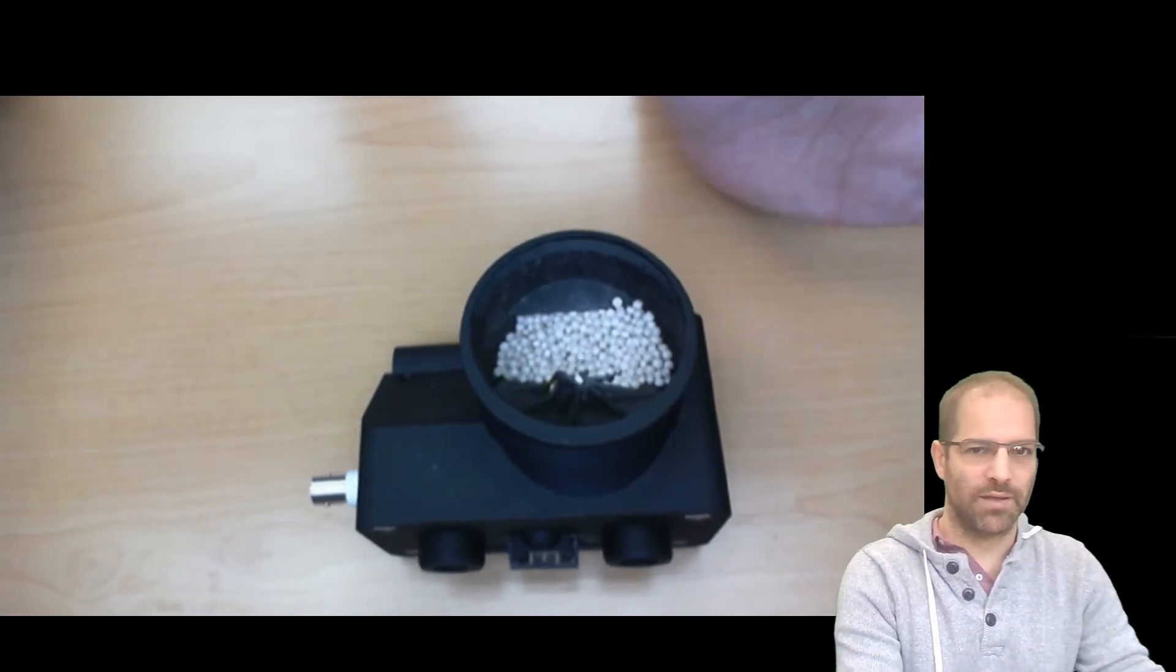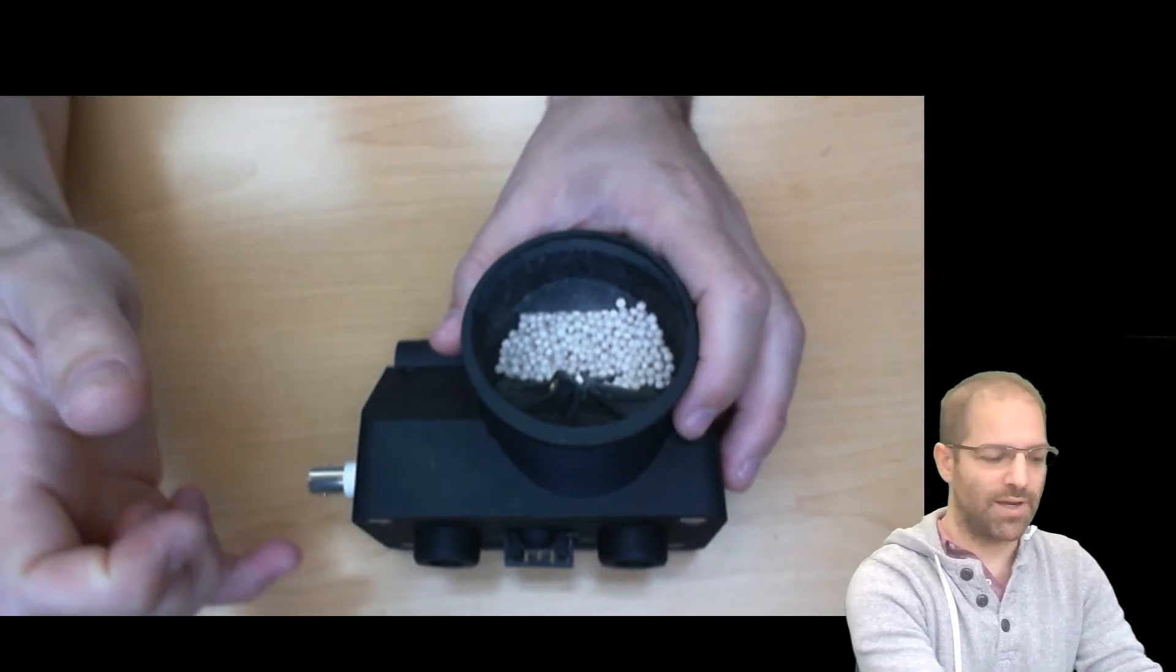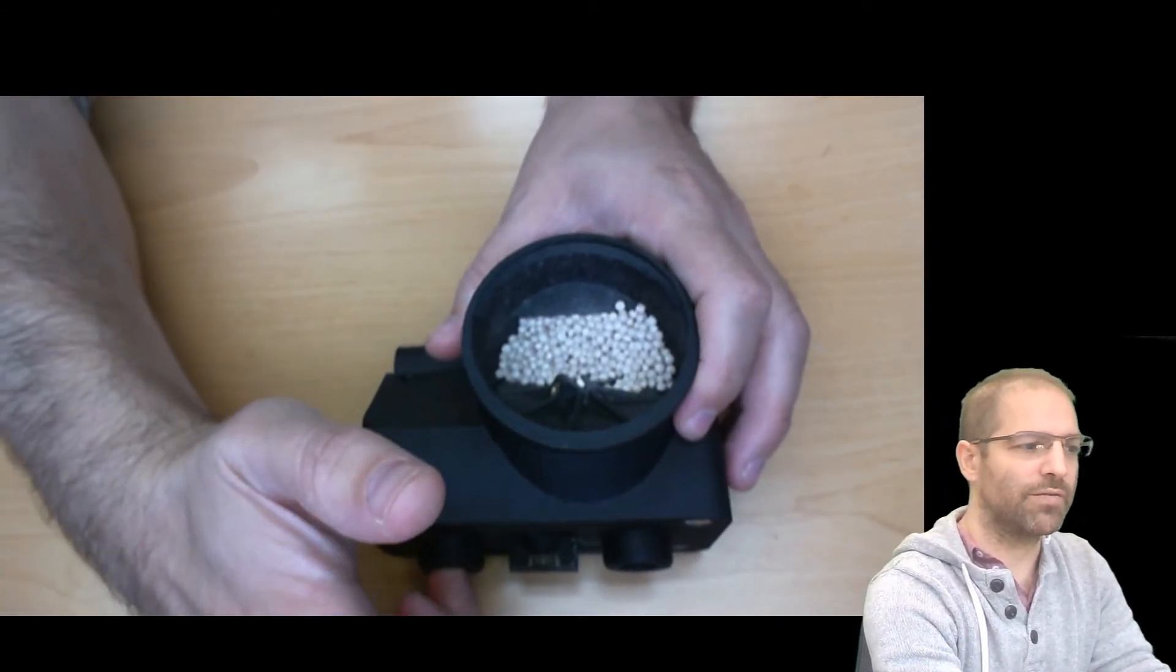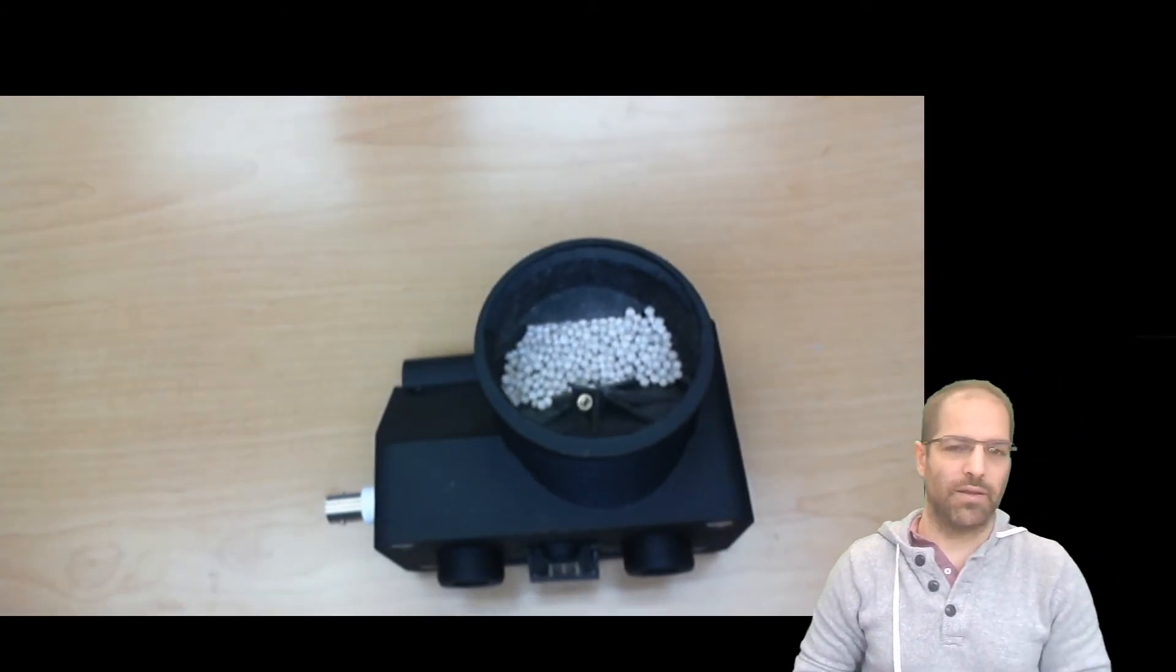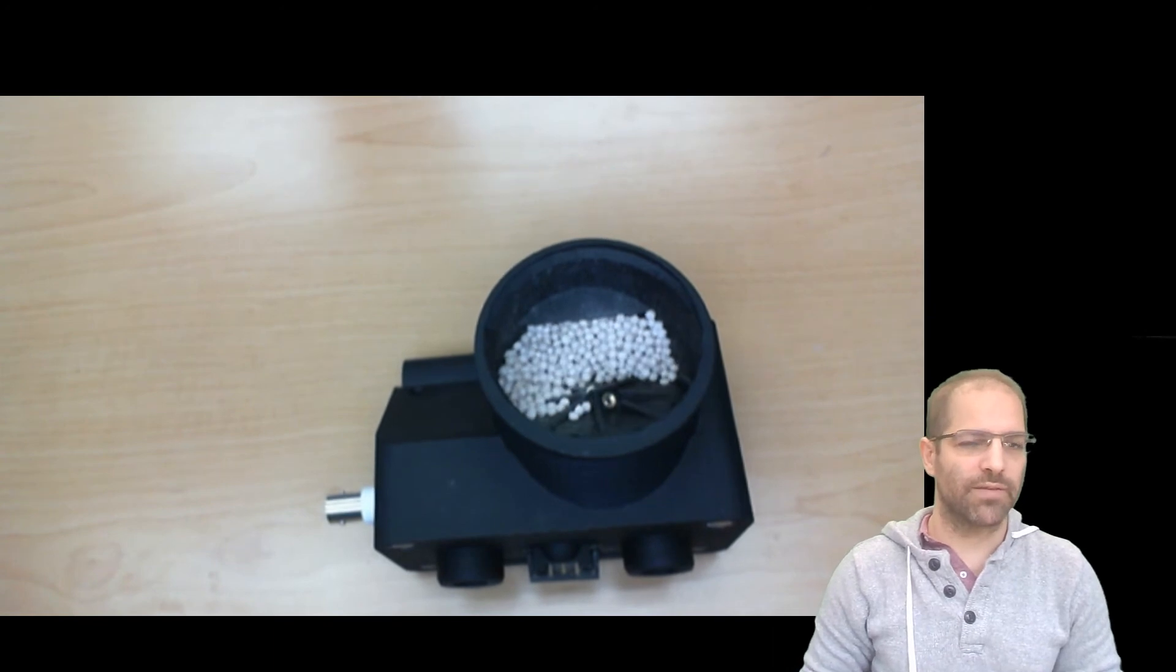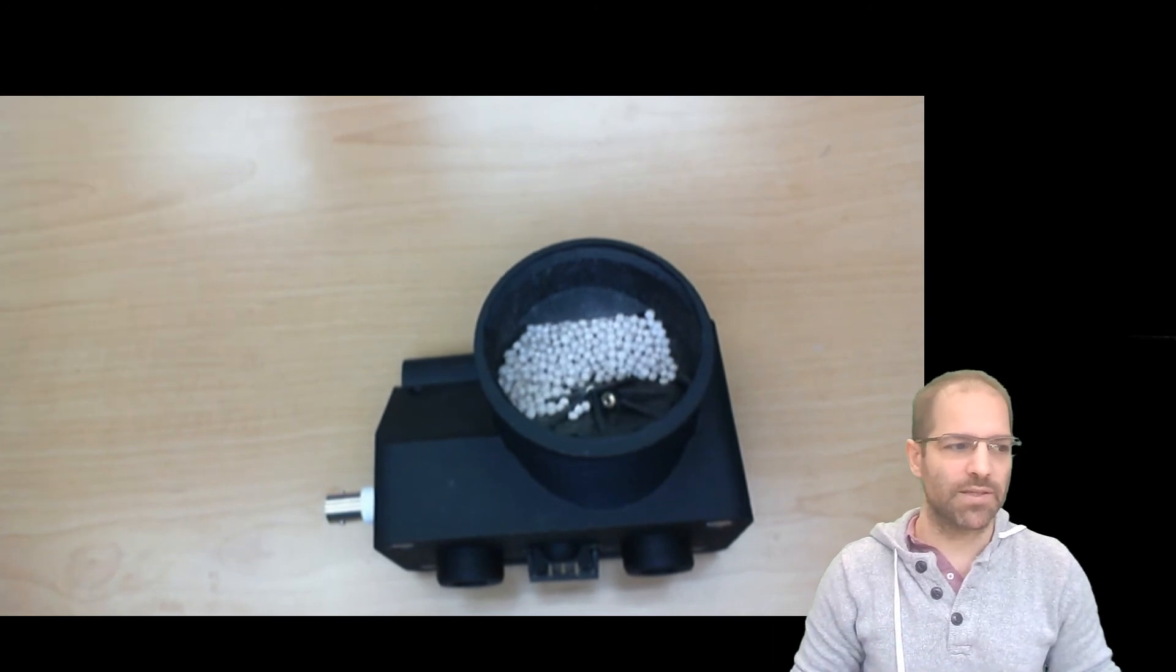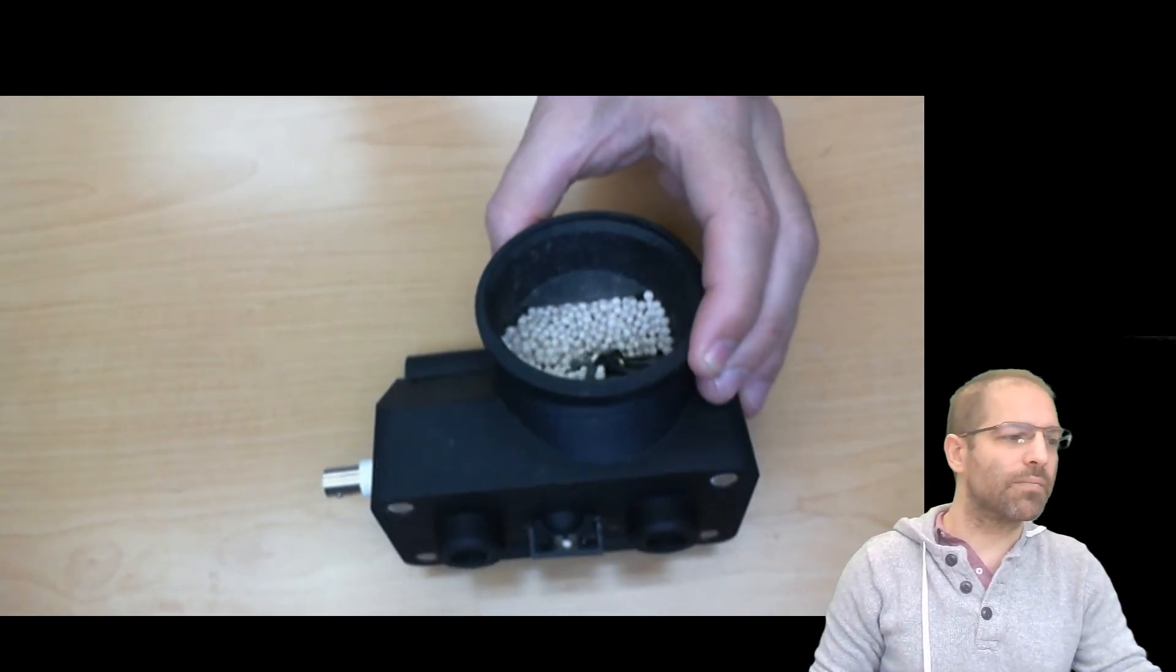So that's the quick start for FED3. This is that FR1 video, so if I poke once on the left, FED3 will activate the pellet dispenser, and it will dispense one pellet.